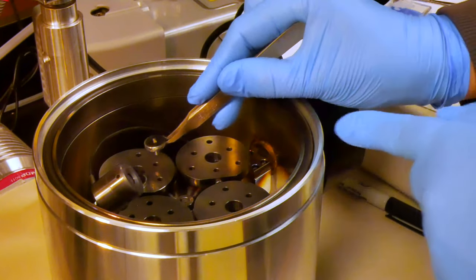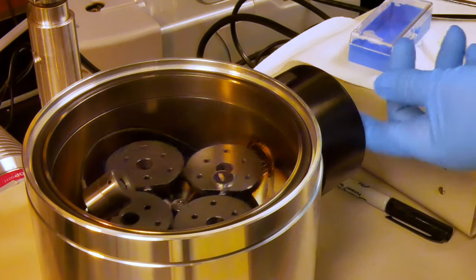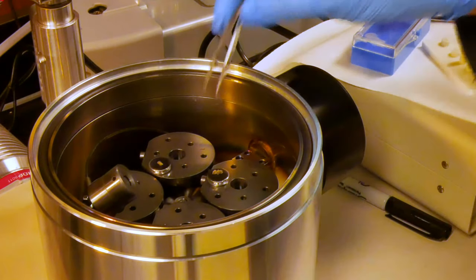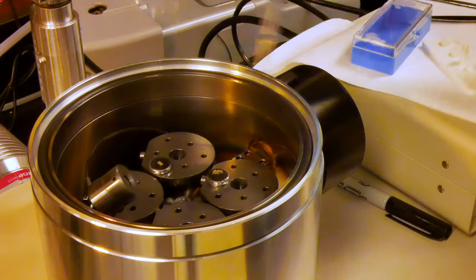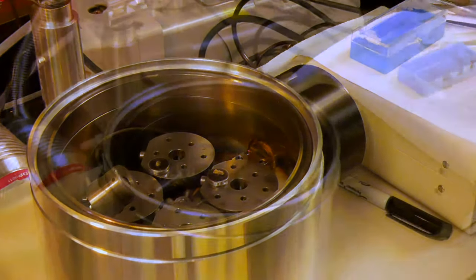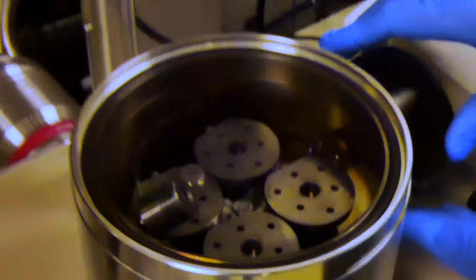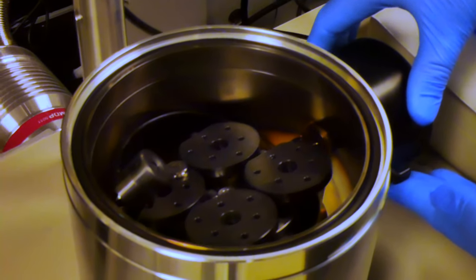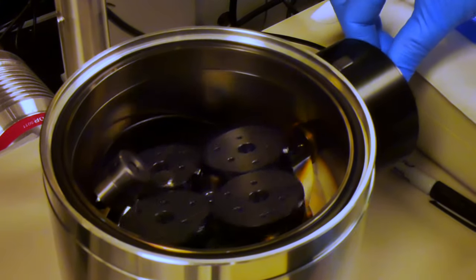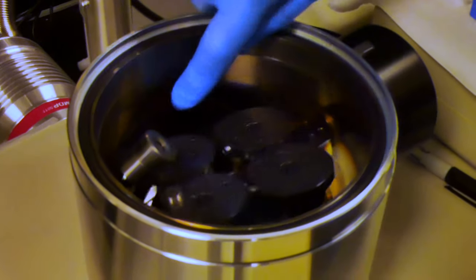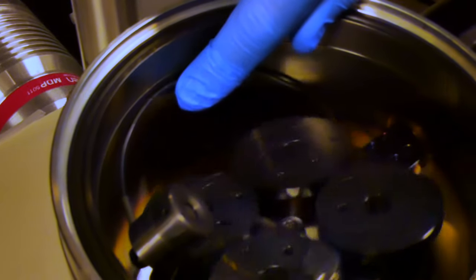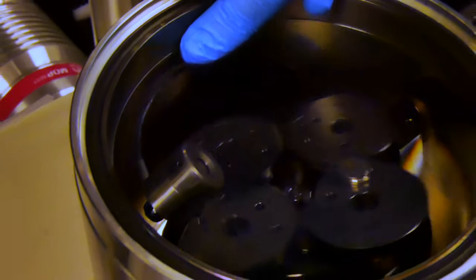If orientation is easier by rotating the stage, the rotation is in the knob. You can do that to place your sample more easily at a better angle. This holder will hold up to 24 samples. With the sample loaded, you want to go ahead and make sure that you've angled your stage back and then secured that angle into a locked position there. Start your rotation slowly, making sure that the cable is out of the way and can't interfere with the rotation of your sample.